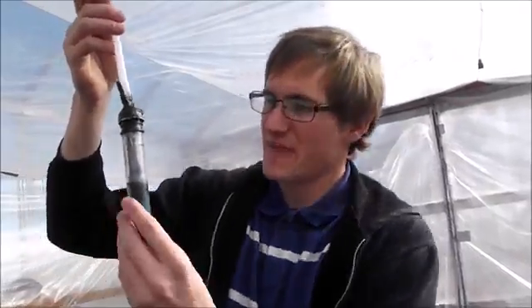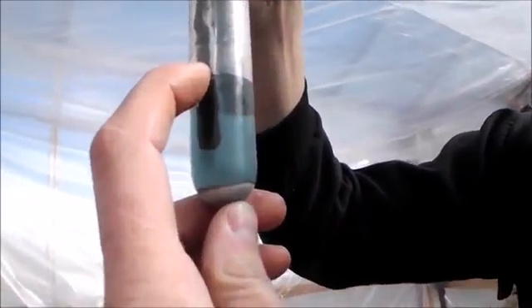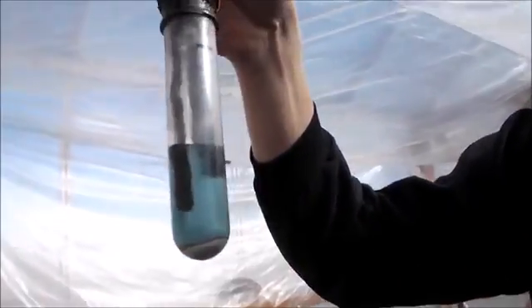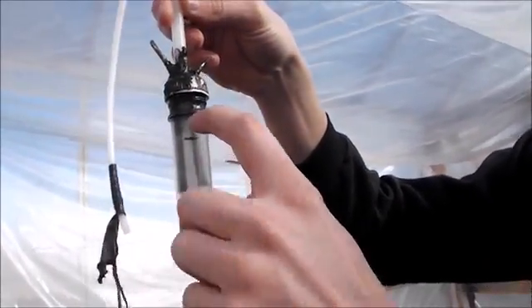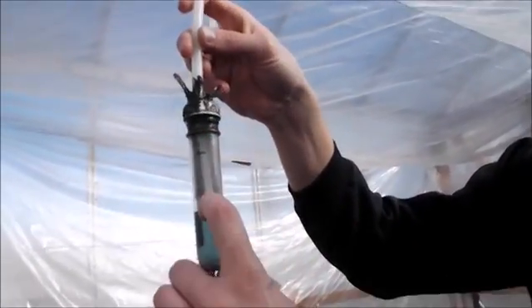Alright everyone, Cody here, still working on my heavy water project. As you can see, this is what I have left - approximately 20 milliliters, possibly less. I've just been electrolyzing it down. I started about there in that glass beaker from the last episode and brought it down to about half of that.